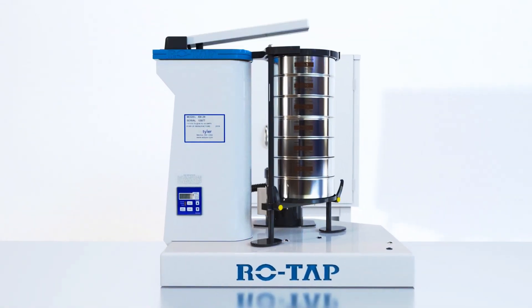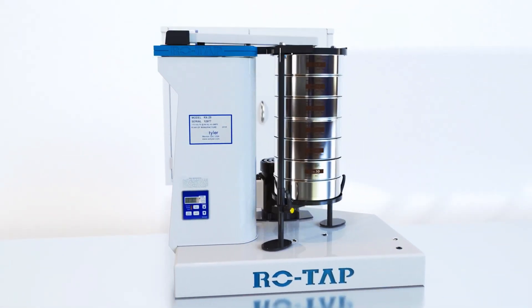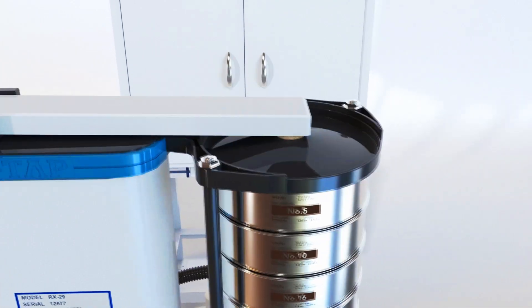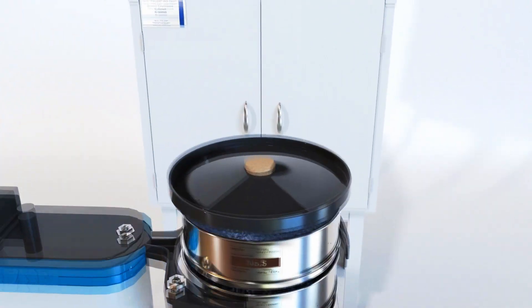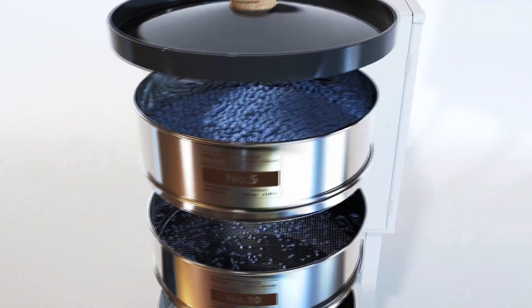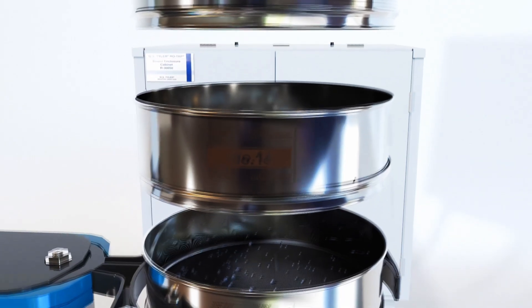Sieve shakers are devices designed to help promote particle movement through a stack of sieves, facilitating accurate particle separation. As the particles separate, they're trapped in the various sieves depending on their size, which allows you to know the average particle size distribution of your sample.